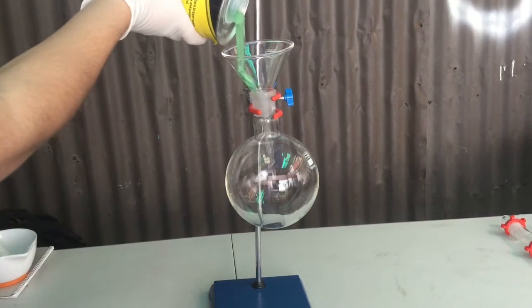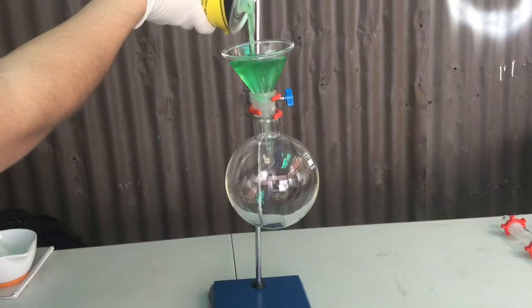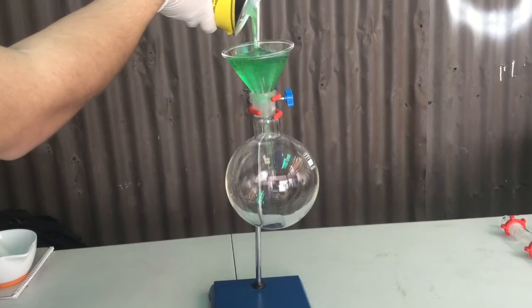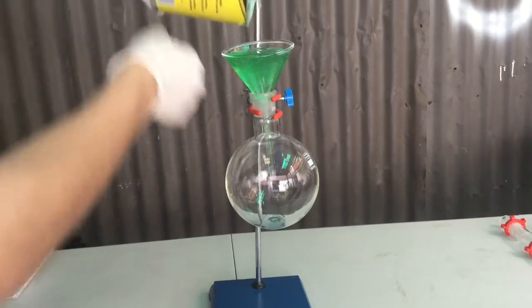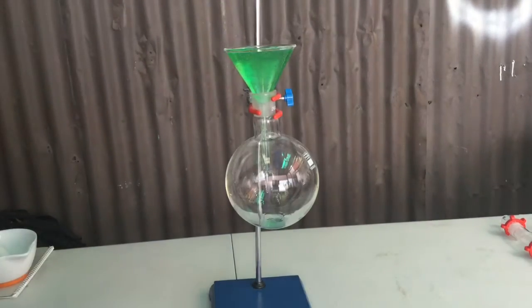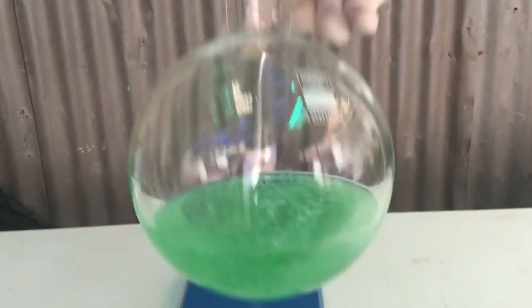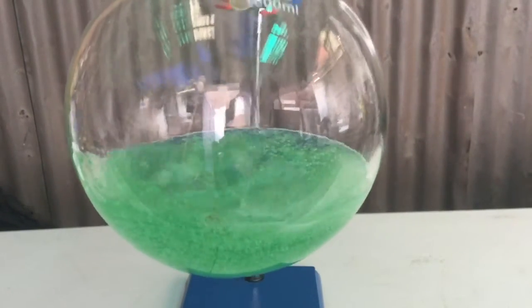First, about 300ml of paint stripper was added to a boiling flask and like most other paint strippers mine came in a gel form which took a while to get into the flask. This is the gel after it was added to the flask.